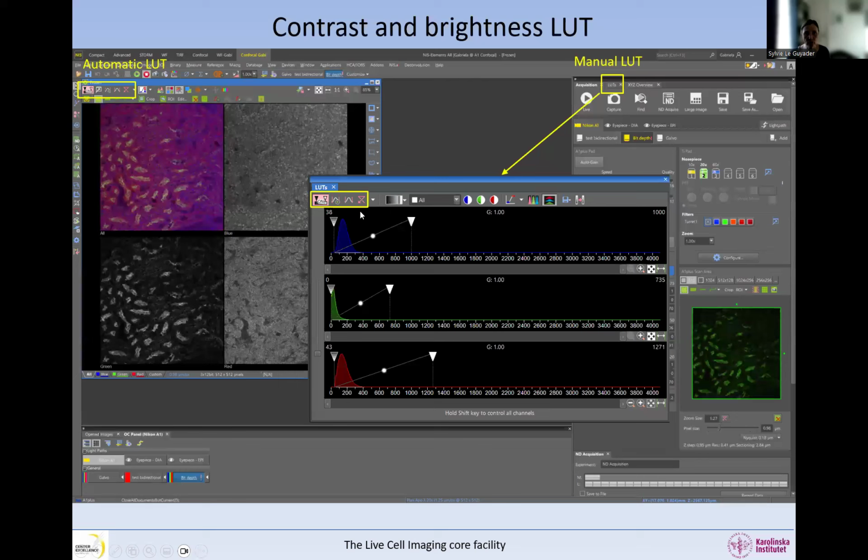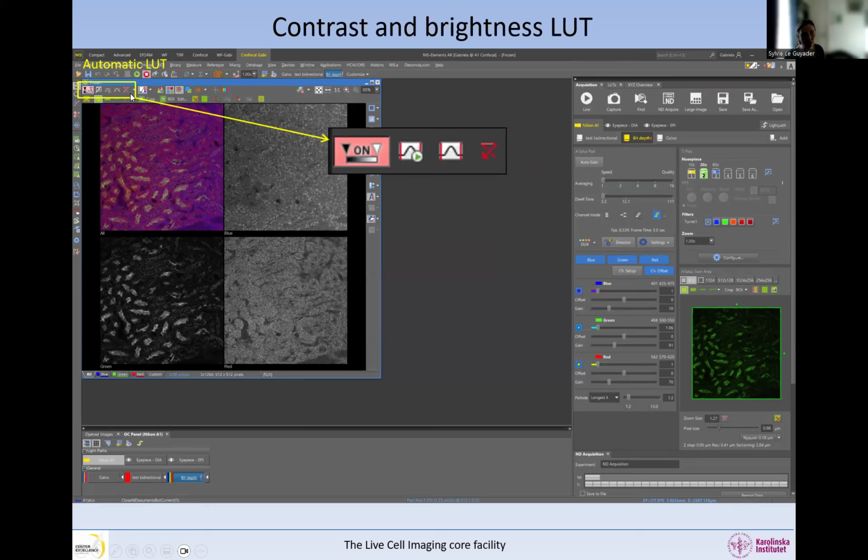We can also do this automatically, and this is what it looks like. In the automatic setting in general, you can just reset everything, or you can toggle it on and off, or you can have something that auto scales. This one will auto scale only one image, so whichever image is open, it auto scales that one. But you often also have a button that allows you to auto scale systematically all the images that you acquire, so anytime you acquire an image, it comes out auto scaled.